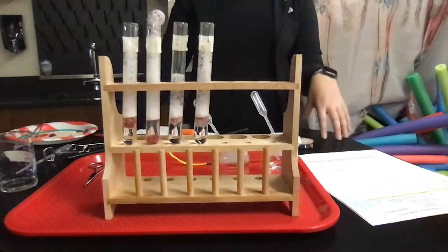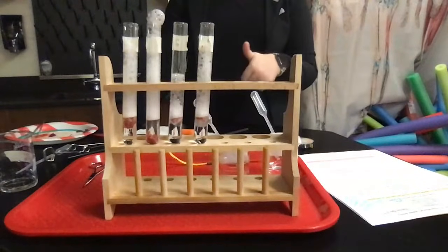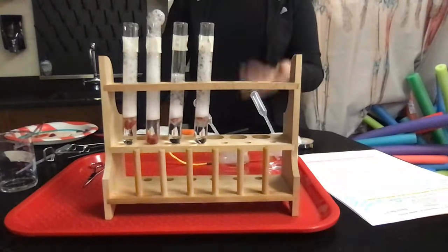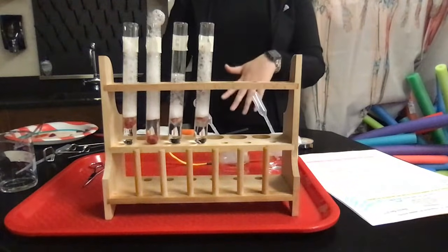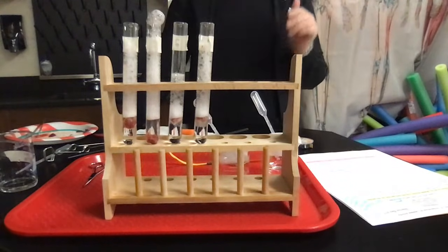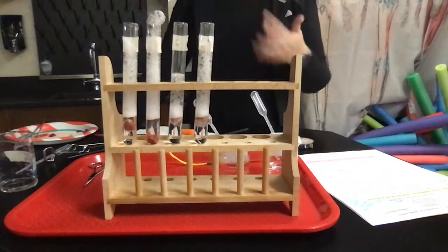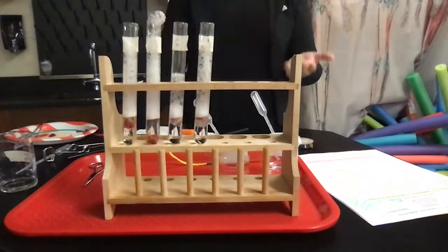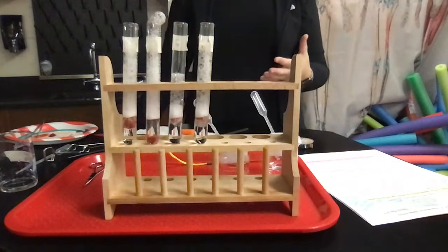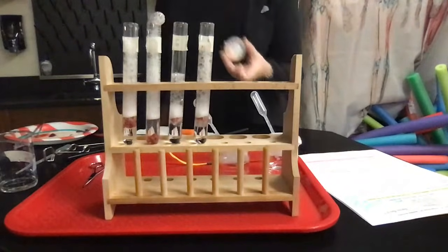We looked at how the temperature affects the activity of catalase. And at the very beginning, we saw that all of the sources that we talked about today did have catalase activity, but the liver had the highest catalase activity. So that's what we used for the remainder of the lab. So I hope that this helps you visualize a little bit. We tell you as teachers, as professors, that enzymes are highly affected by their temperature and by their pH. And some enzymes are a little bit more picky than others, so that if you're off by 1 or 2 pH levels, it's not going to function even a little bit.